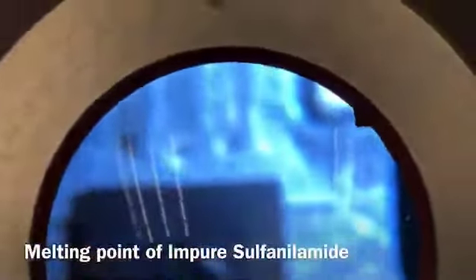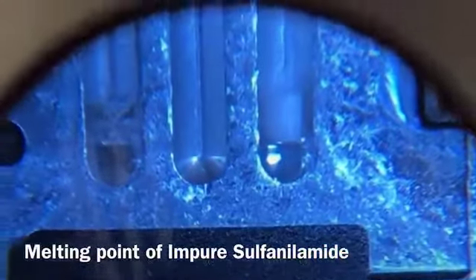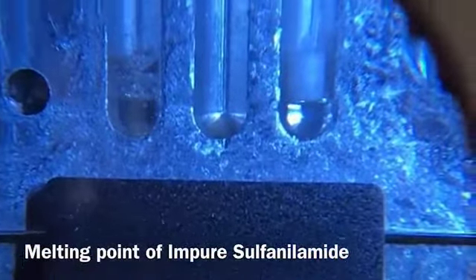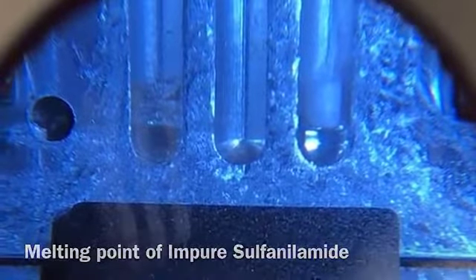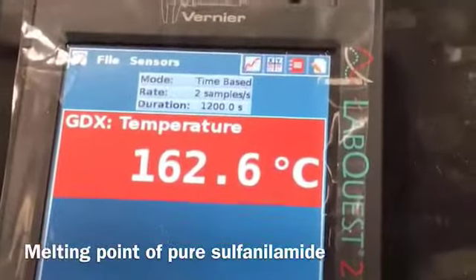And that's the sample. You can see the left hand side melting point tube, the impure sample, is in the melted form. The sample on the right has not started melting yet.